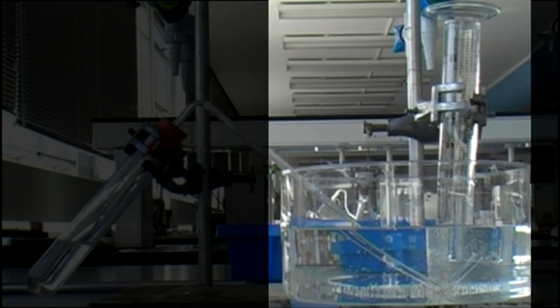On the right we can see a trough filled with water along with an inverted or upside down measuring cylinder which is also filled with water. You are more likely to collect your gas in a test tube or boiling tube, but a measuring cylinder allows you to measure the volume of gas produced.